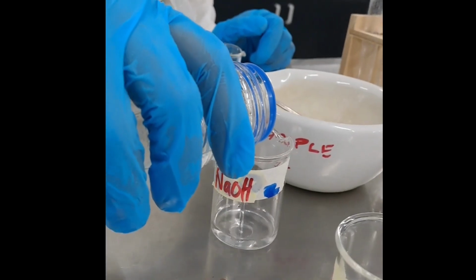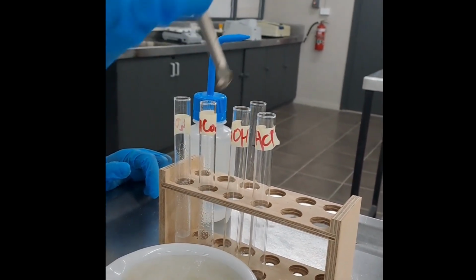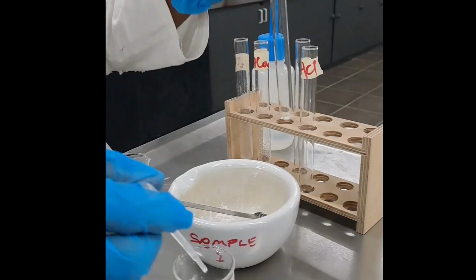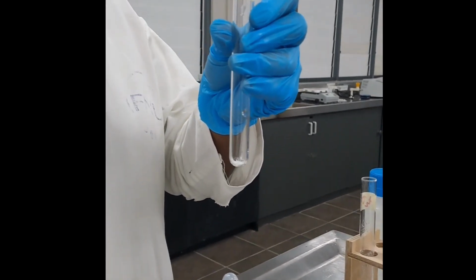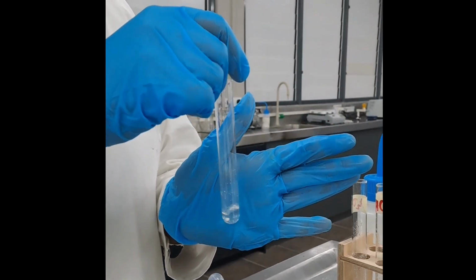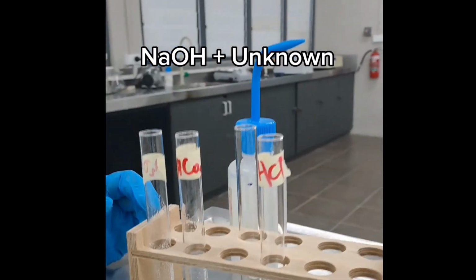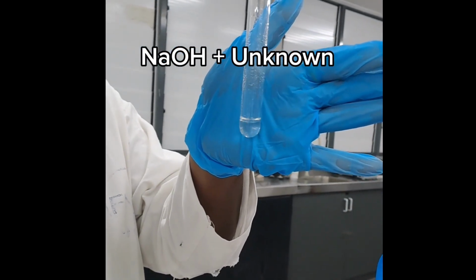Next up, we are going to take a small quantity of the unknown and add it to the test tube labeled NaOH. Add a few drops of NaOH to the test tube. Shake the test tube properly and observe the mixture carefully. It can be seen that the unknown substance was soluble in NaOH.